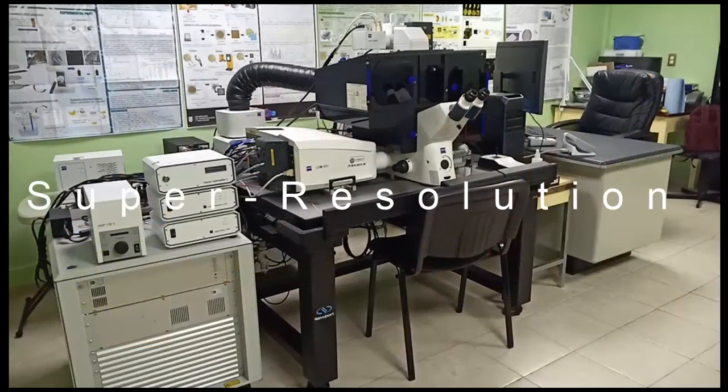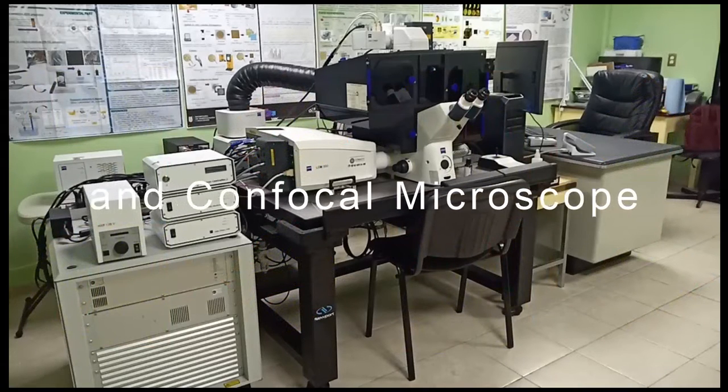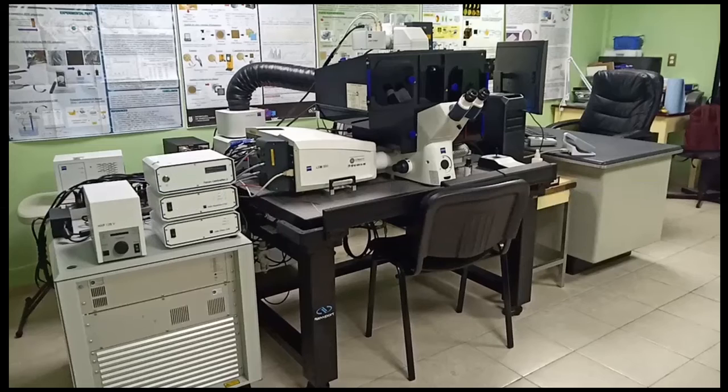And finally, we are talking about the super resolution and confocal microscopy that we have in our laboratory. This microscope is one of a kind in Mexico, and we are glad to have it in our laboratory. This is a normal confocal microscope adapted with a module for super resolution that I explained before.